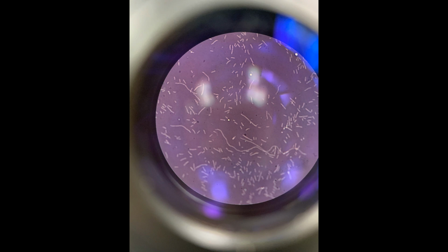So the reason this is called a negative stain is because the stain actually is negatively charged and is repelled by the cell wall, or the cell membrane, which is also negatively charged. And so you get the exclusion of the dye from the cell, but the dye actually stains the background of the slide. You notice we didn't rinse with water, we didn't heat fix, because we're not doing any of those rinsing steps. We're just doing that one smear.